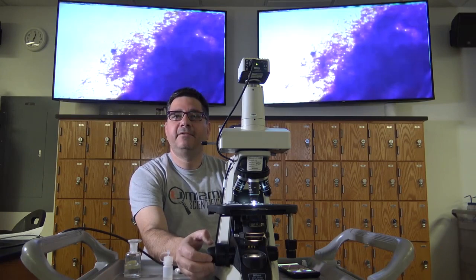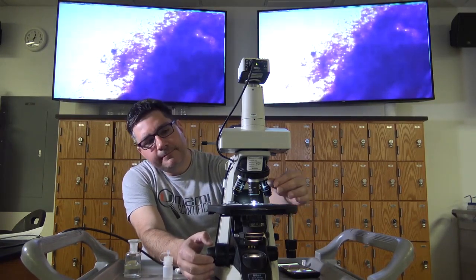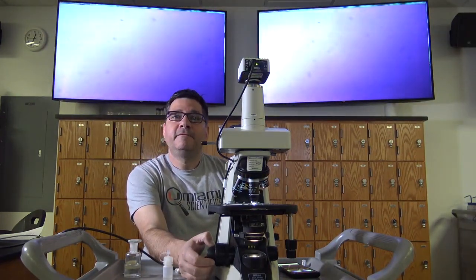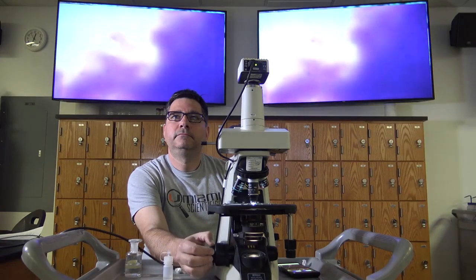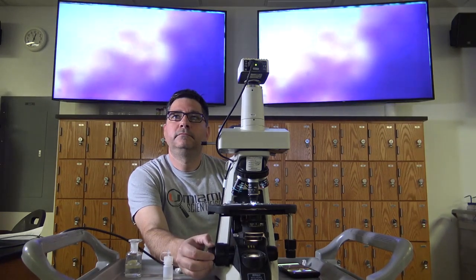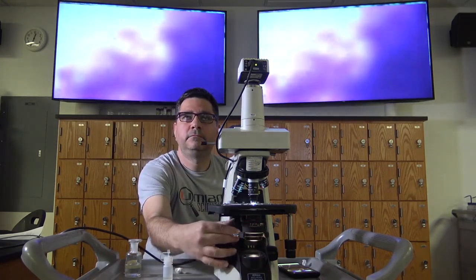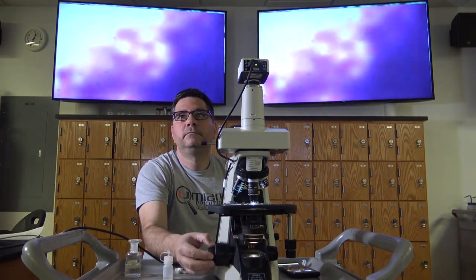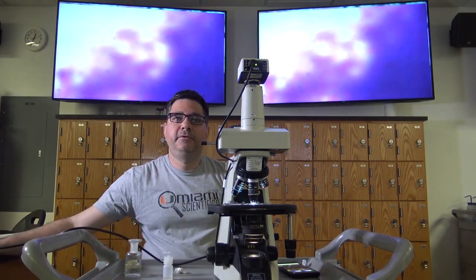Using the turret, dial the scope to the 100x objective, also known as the oil immersion objective. Find focus and adjust the diaphragm and condenser. As you can see, the specimen is not clearly visible.